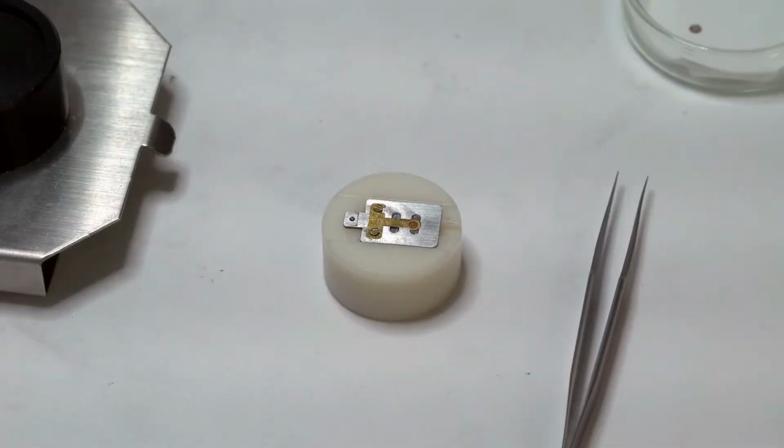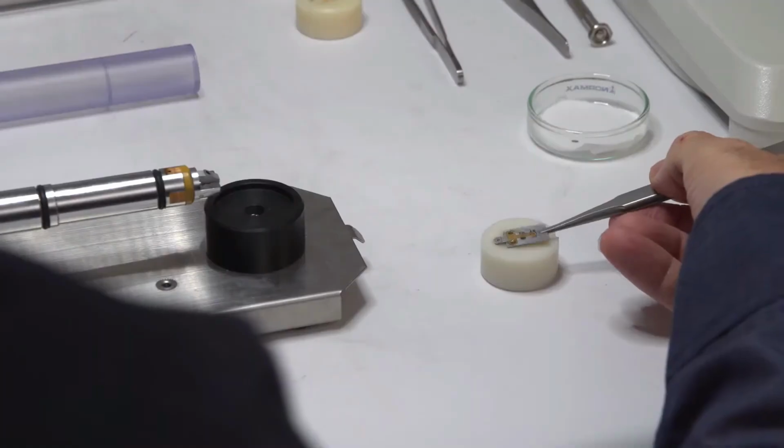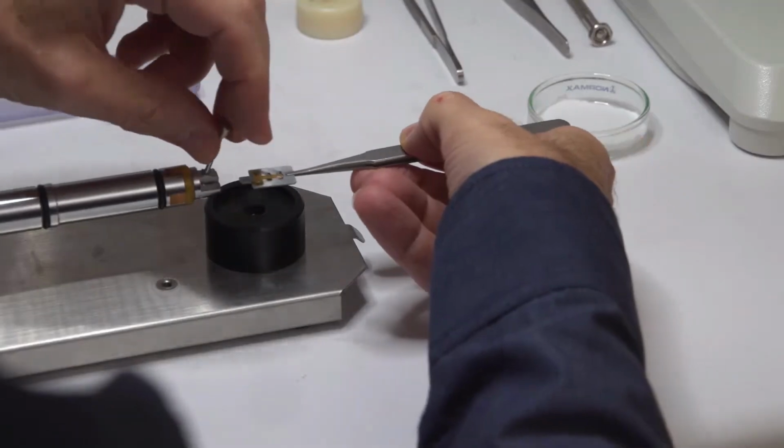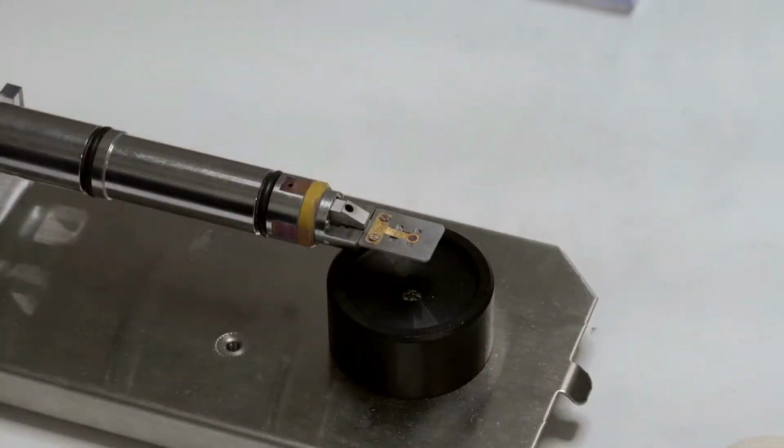Okay, so we'll load our sample into the microscope now. We've already applied it to the copper grid, and we'll put the copper grid into the tip, the removable tip you can see here. And so now we'll load that onto our sample rod, thus. And now we can put that into the microscope.